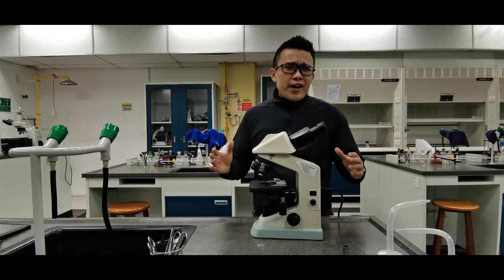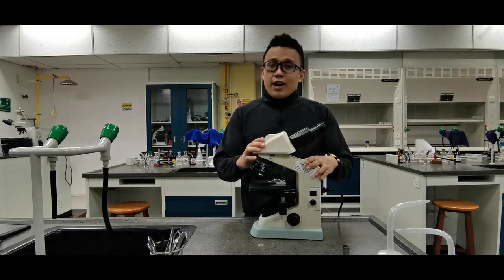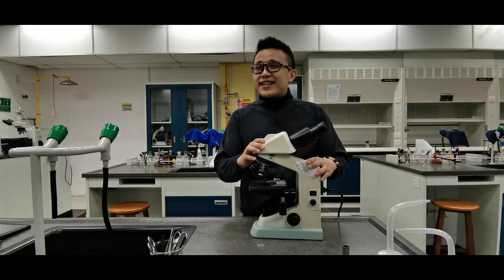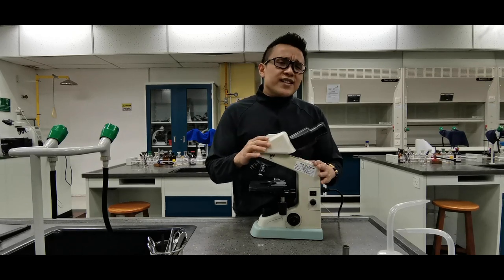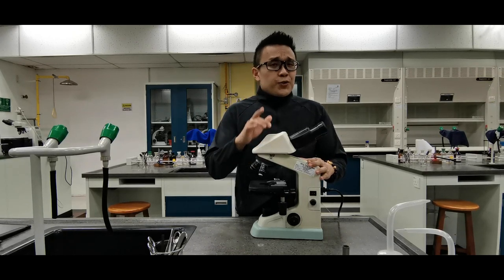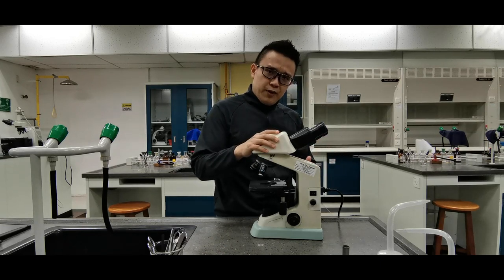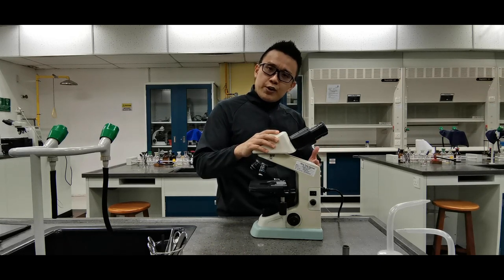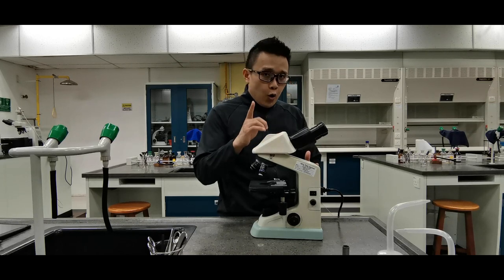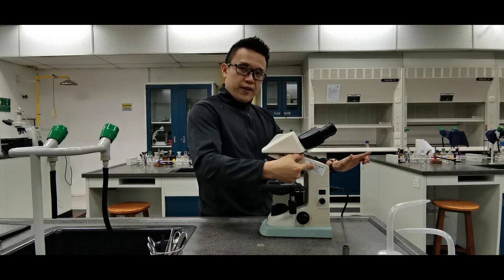When you take a microscope right out of its case it's going to look more or less like this. It may not look and feel the same for all brands and types, but a basic setup will more or less be the same. Let's start with the spine of the microscope — this part right here. Always remember the spine should be facing away from you.